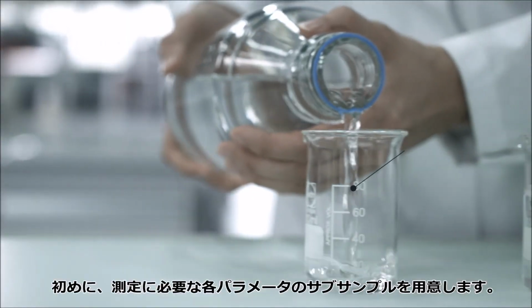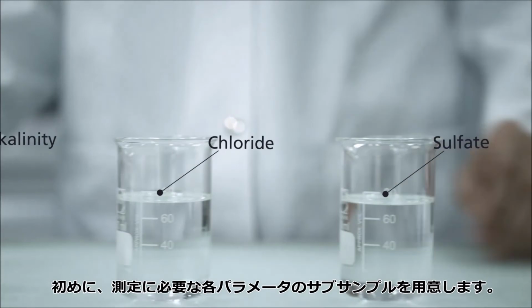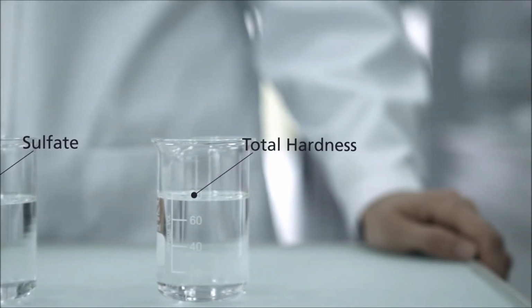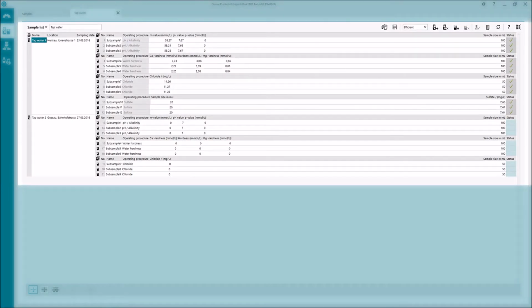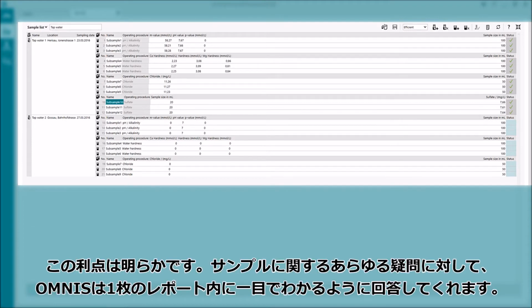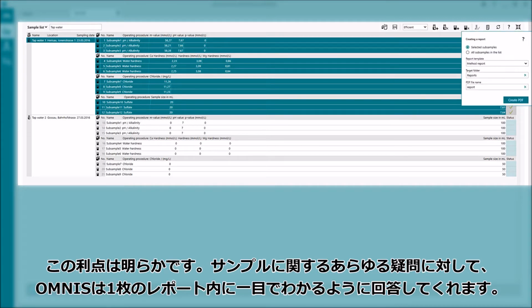In a first step, you define a subsample for each parameter you need to determine. After completing the analysis of the subsamples, OMNIS collects the results for each parameter and connects them to your sample. The benefit is clear. Whatever your questions regarding the sample are, OMNIS answers them at a single glance in a single report.